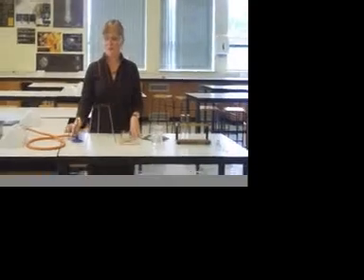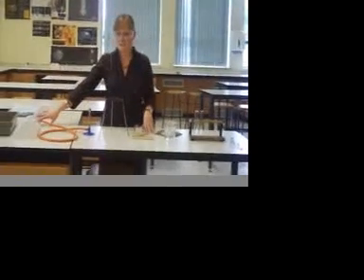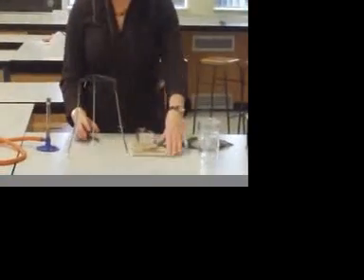I'm going to show you how to safely heat a beaker of water using a Bunsen burner. I have here a Bunsen burner which is already attached to the gas tap, a tripod, and a gauze mat.